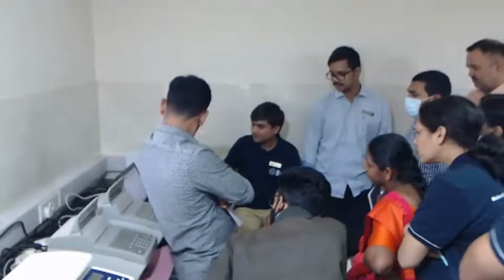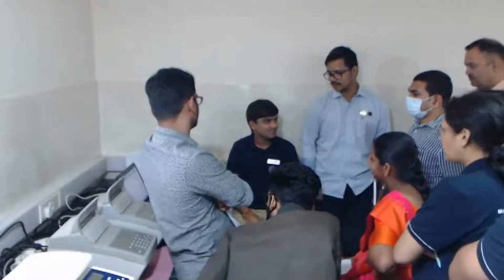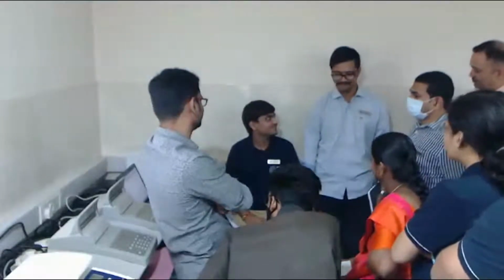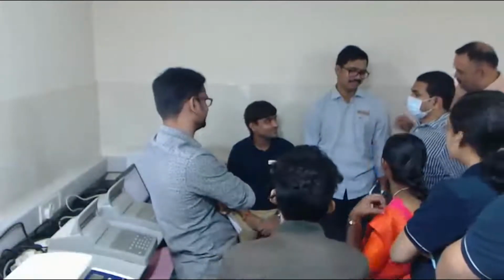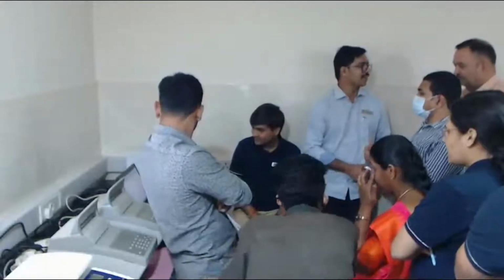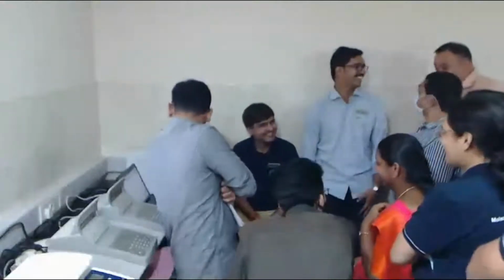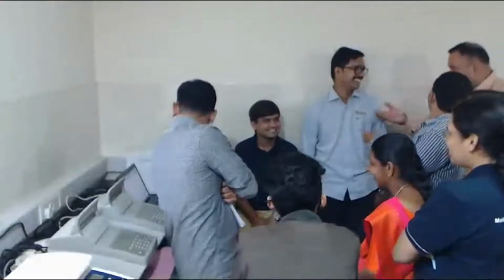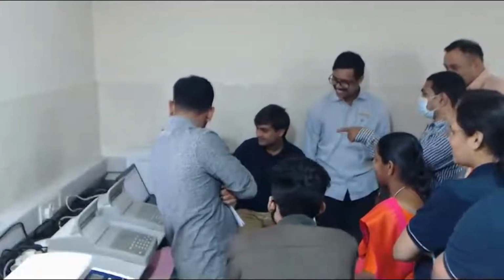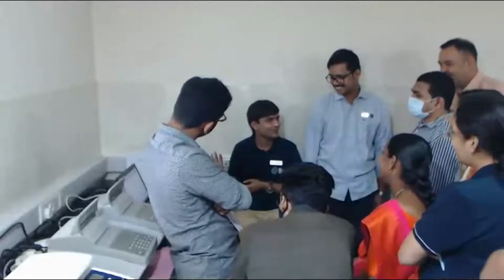Finally, if we look at the blank one, there's no cross contamination. I can share this PDF with you, no problem.